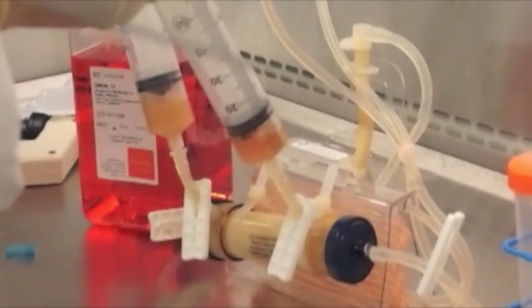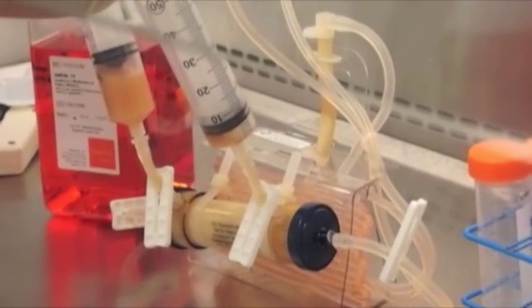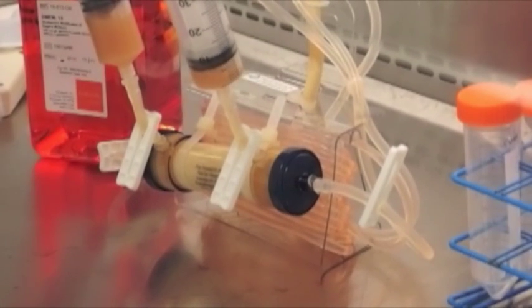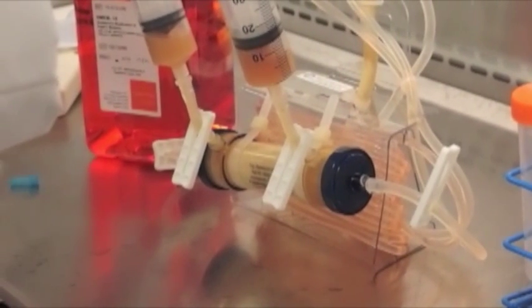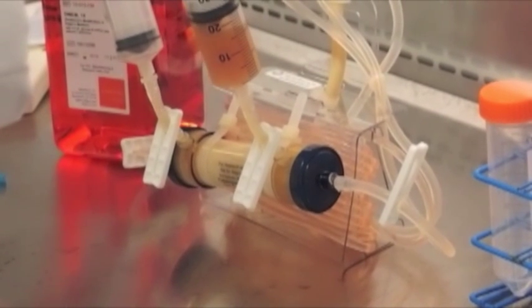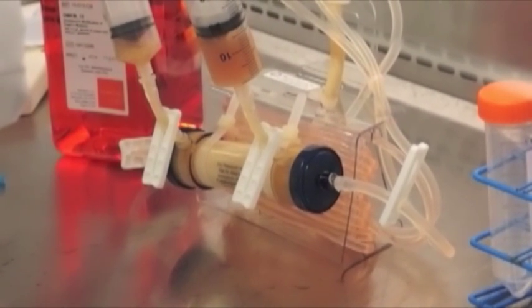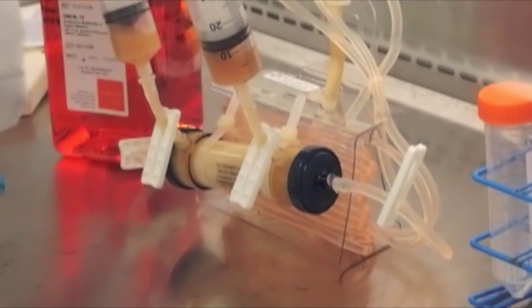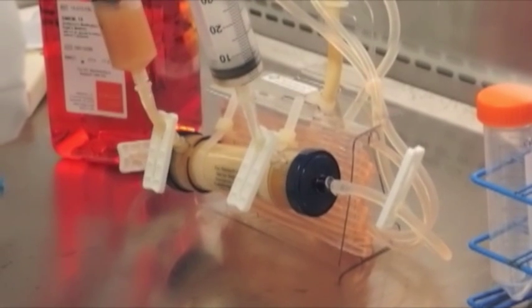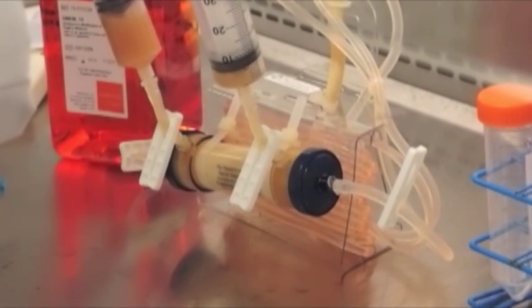The cell numbers harvested were equal to that which were pulled from 12 Corning 2 stacks. However, the use of CDMHD, a chemically defined media for high density cell culture which is protein free, animal component free, and chemically defined, reduced the adherence of cells to one another and allowed them to be harvested easily from the cartridge without the use of any enzyme.